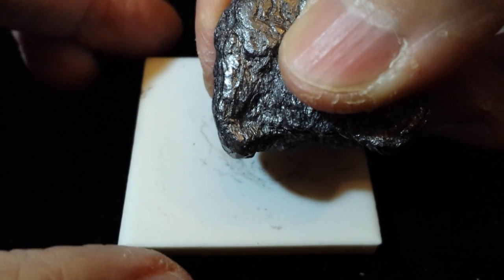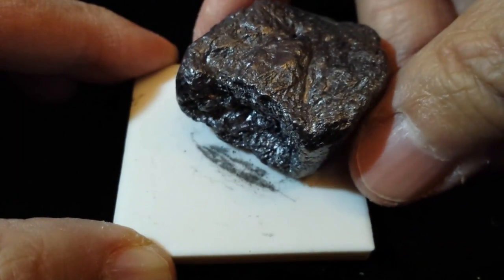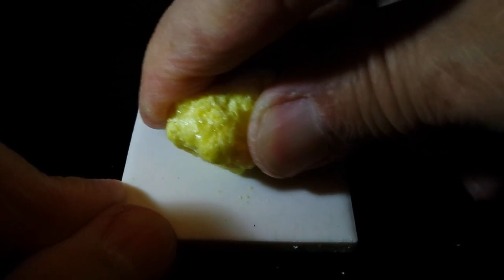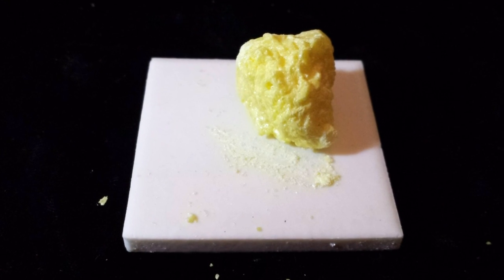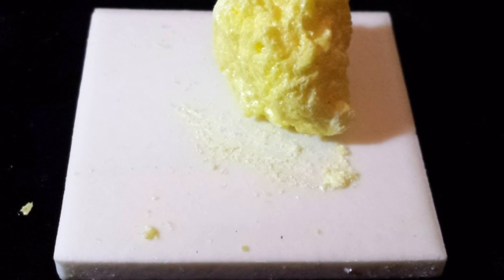A streak is made by crushing a sharp edge or corner of a mineral against a streak plate. The streak plate is made of fused silica or porcelain, which typically has a hardness value of about seven on the Mohs scale. If the mineral has a hardness significantly less than the streak plate, a short sharp stroke with downward force will leave a line of crushed powder from which we identify the mineral's streak color.